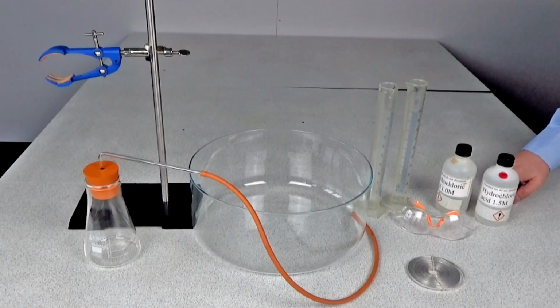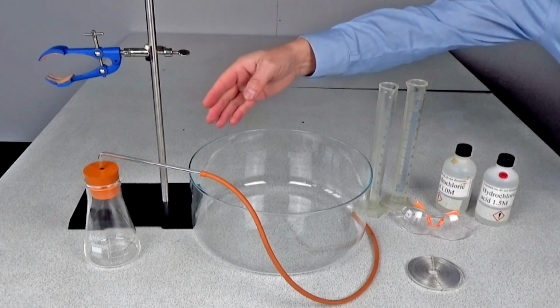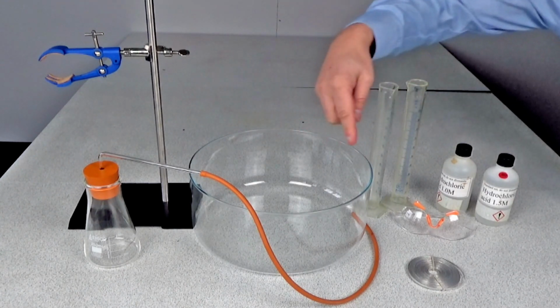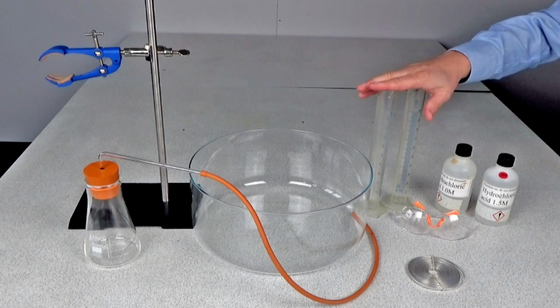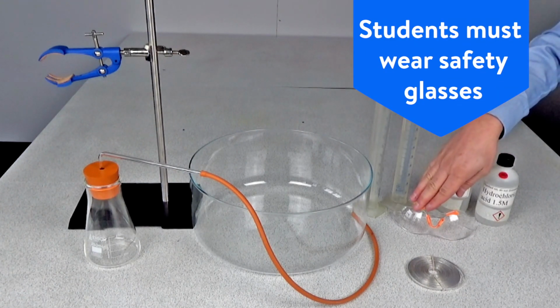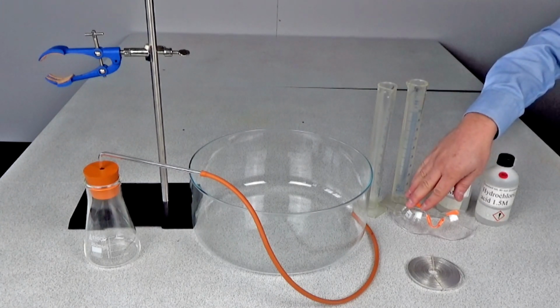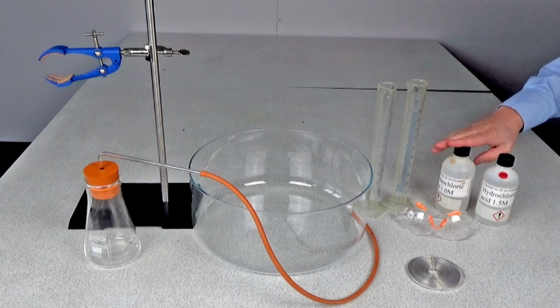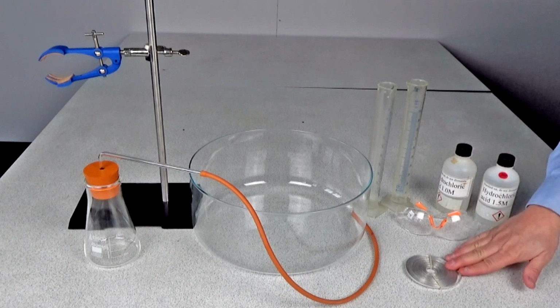For this practical, you'll need a water trough, a retort stand, a conical flask fitted with a bung and delivery tube. You'll need two measuring cylinders, one to measure the volume of hydrochloric acid and one to measure the volume of gas produced. It's really important that your students wear safety goggles throughout the experiment. You'll also need the reactants. We're using 1 molar hydrochloric acid and 1.5 molar hydrochloric acid, and we're going to react that with some magnesium ribbon.